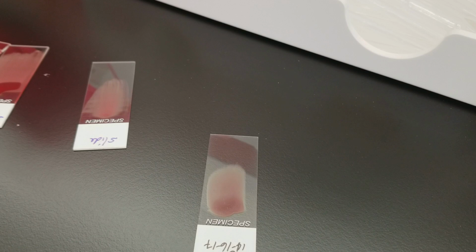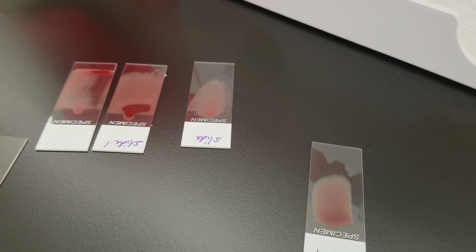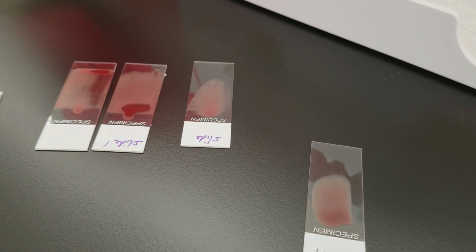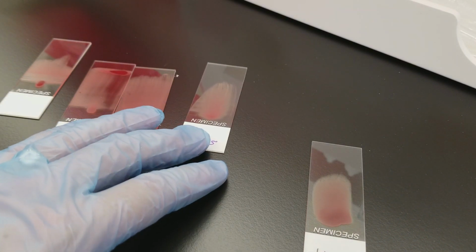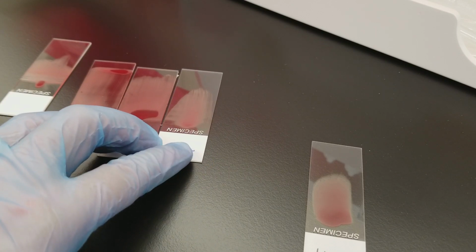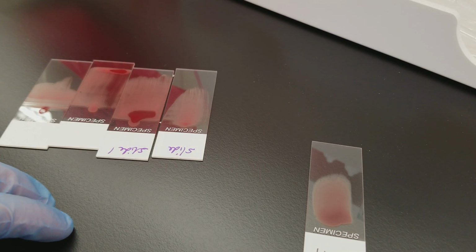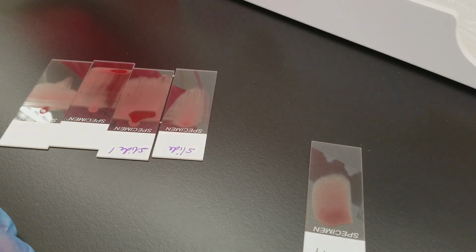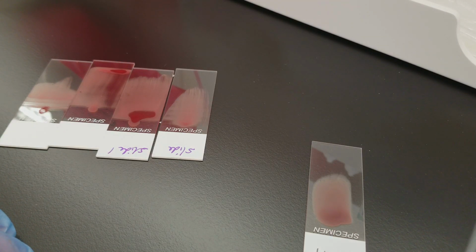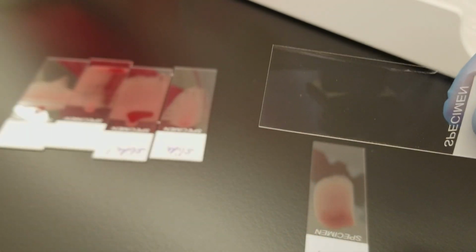All right, so I hope that's helpful. I know that it wasn't perfect by any means, but when you practice doing it, it's a lot better without a camera. And to me, it seemed like a cool way for people to explore how to make good peripheral blood smears. And maybe if you have questionable dexterity sometimes, using the side of the slide would help you, because it gives you more control over the actual pressure that you put on there.